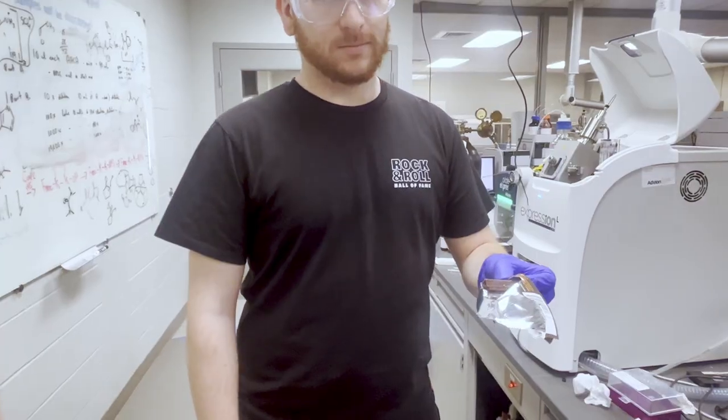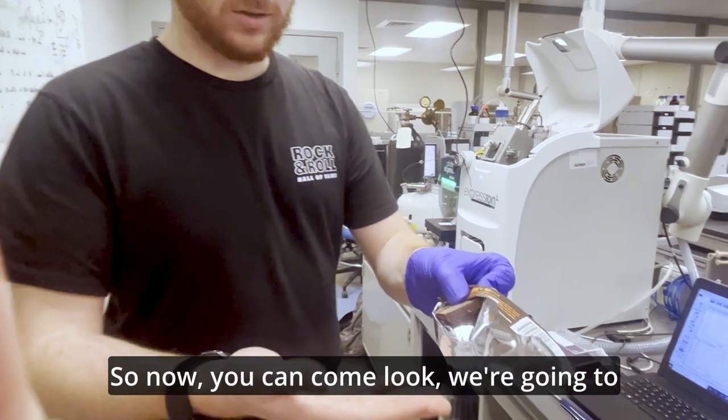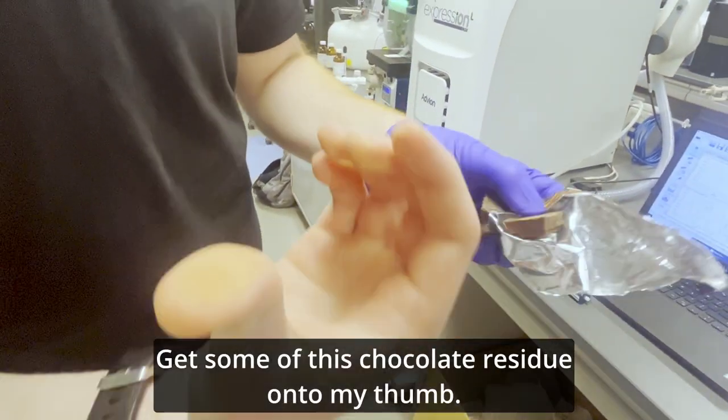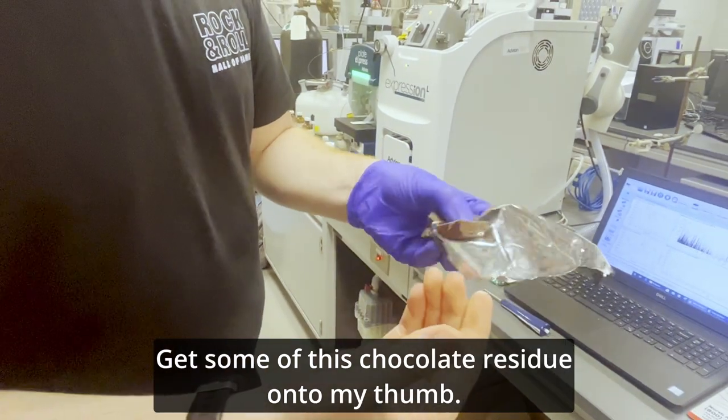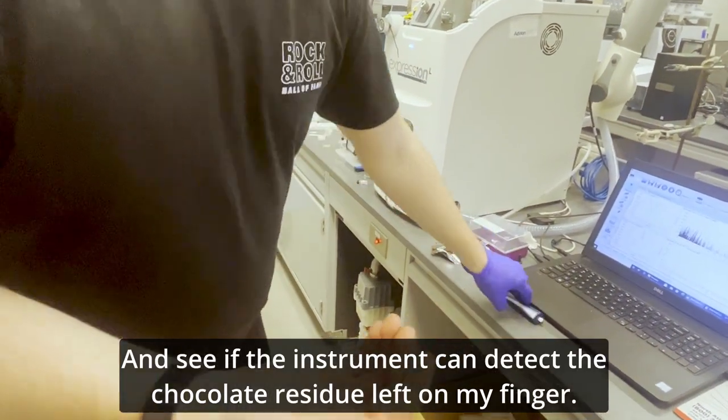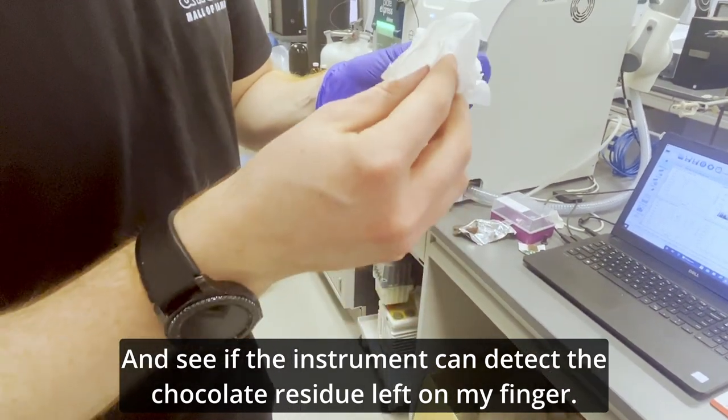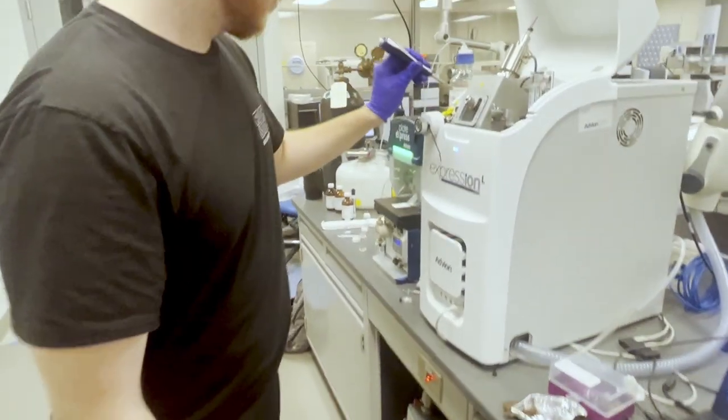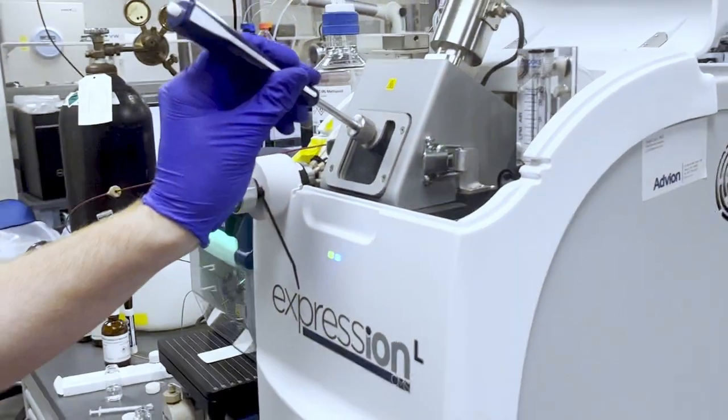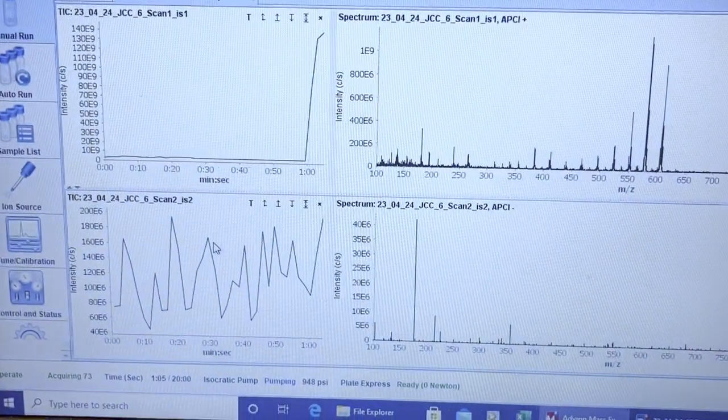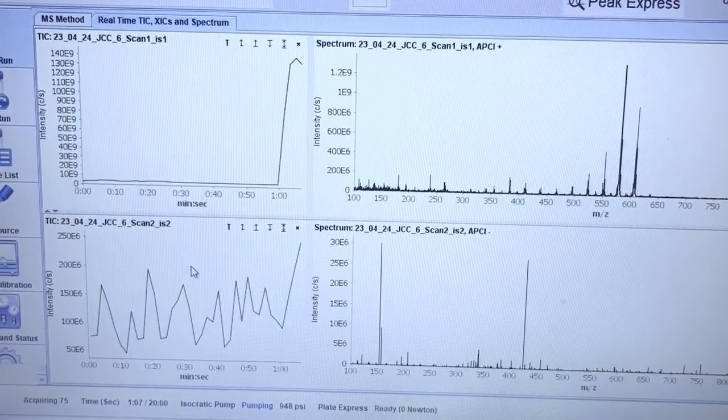Okay. So now we're going to get some of this chocolate residue onto my thumb and see if the instrument can detect the chocolate residue left on my finger. Hello.